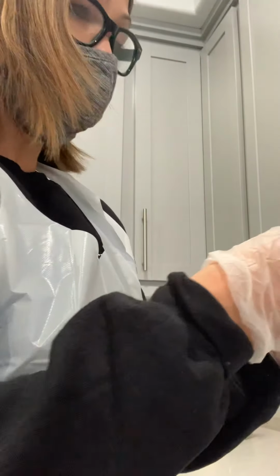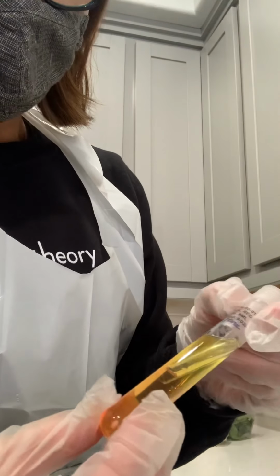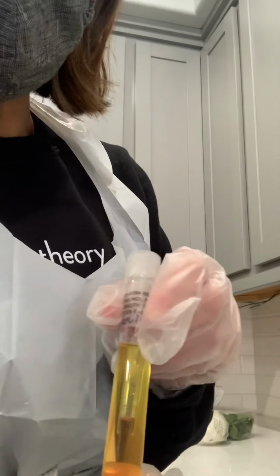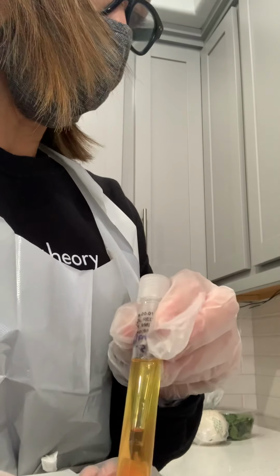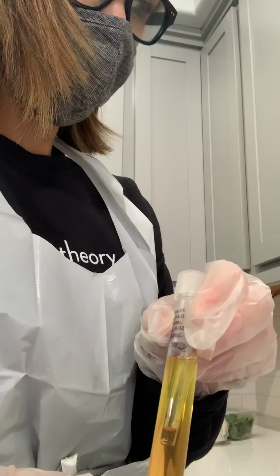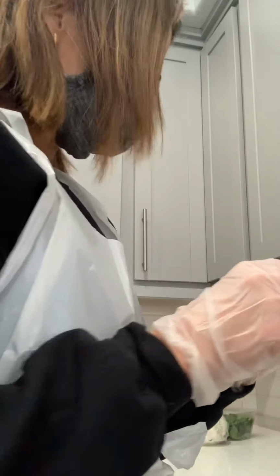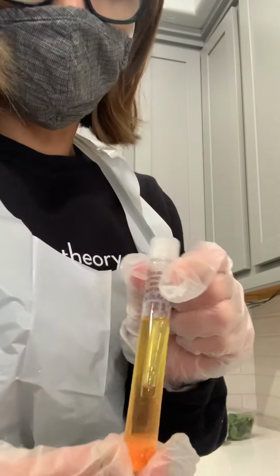The next one is the fructose. It's the same way. There's also acid and gas fermentation because it's yellow, and you see the color change, the production of gas and acid. So that's a good result. The last one is the mannitol, which has the same results.